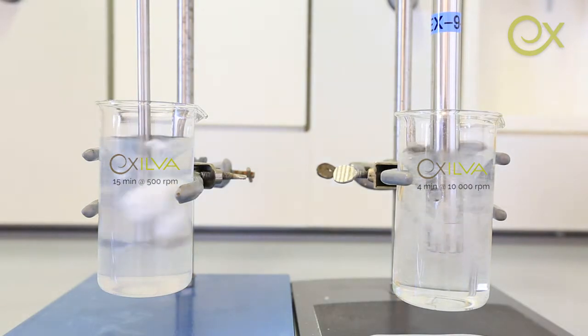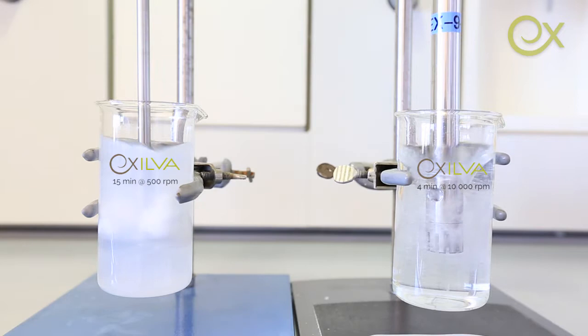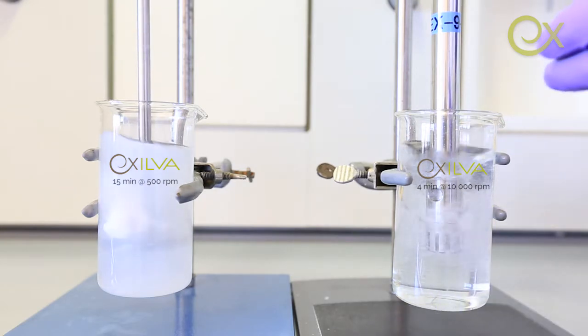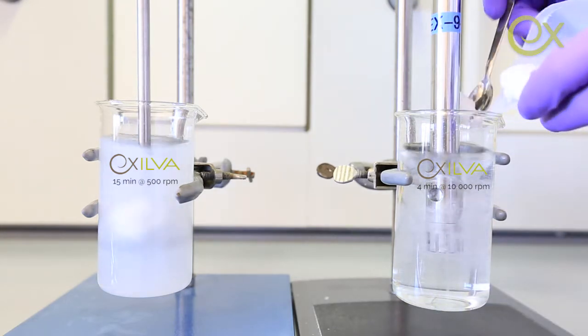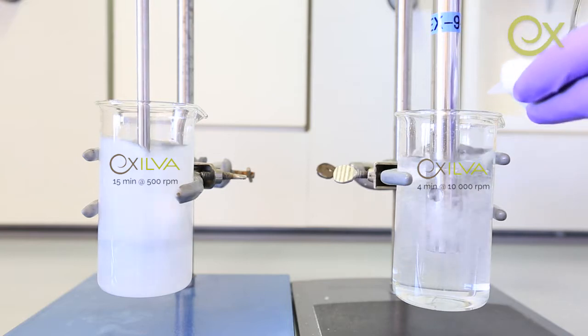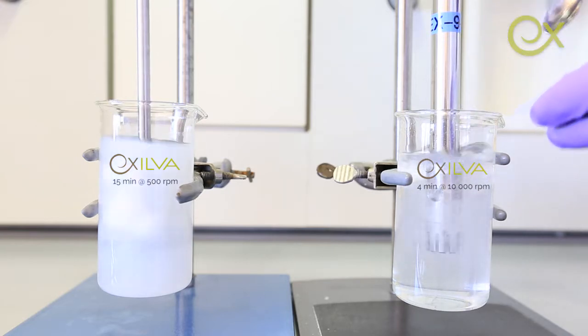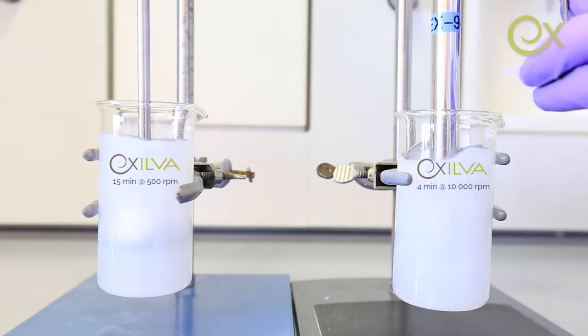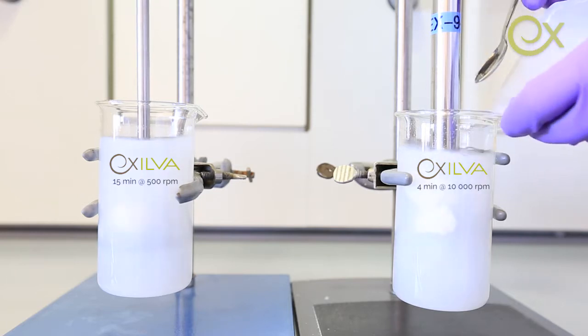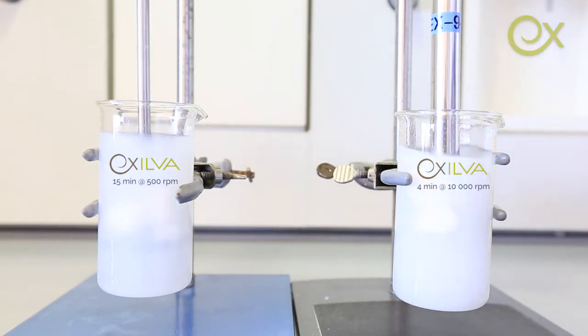In this dispersing video, we will show you how inadequate low shear dispersion shown to the left and adequate high shear dispersion shown to the right will affect the performance of Exilva. Here, we are preparing a 0.7% Exilva suspension by diluting the 10% Exilva paste into water.